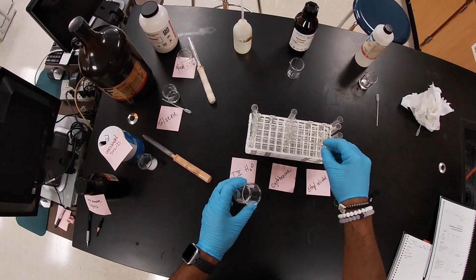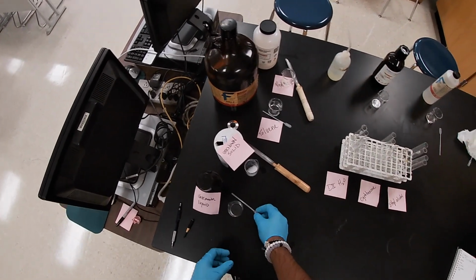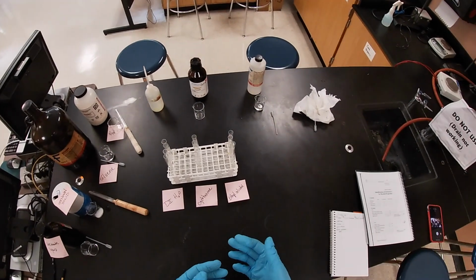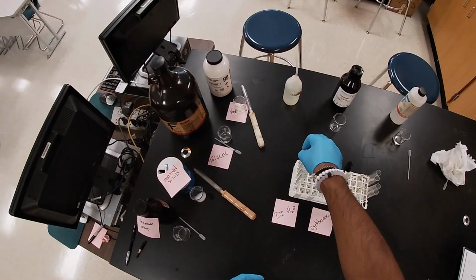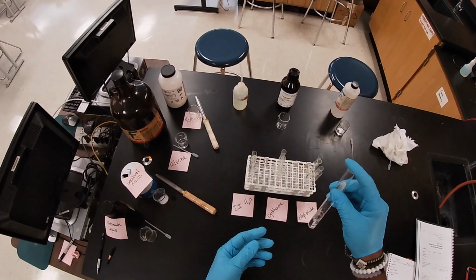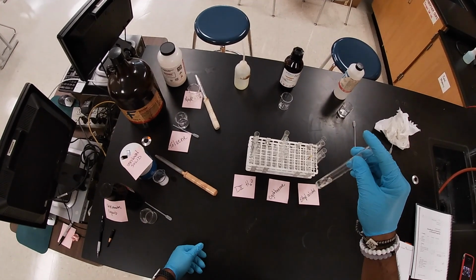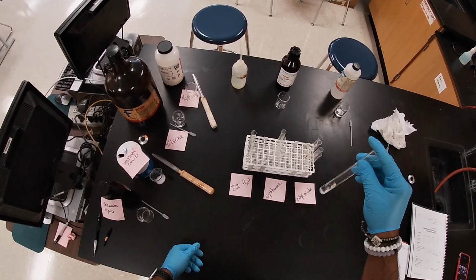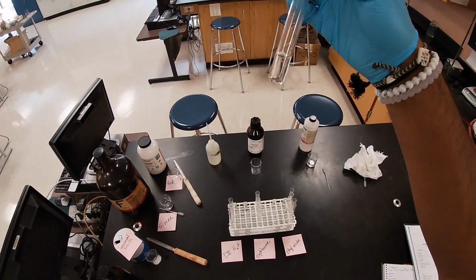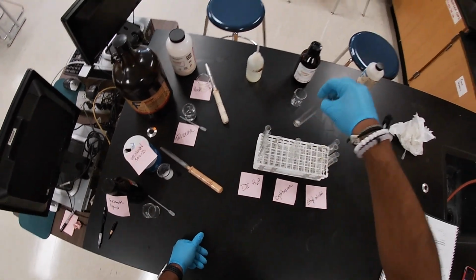All right. Now we're going to check our observations, and determine whether it's soluble or not based on what you see in the test tube. So first, we're going to have naphthalene and water. I'm going to shake a little bit, see if it dissolves. Okay, and it seems not to be, right? We're going to check back in 15 minutes to see if it actually dissolves or not.